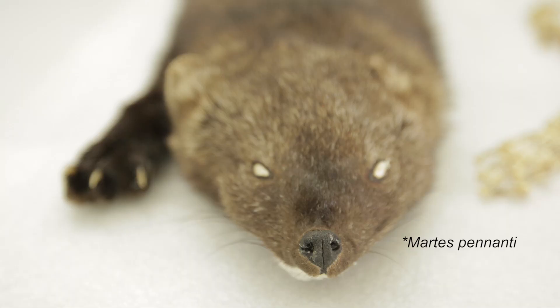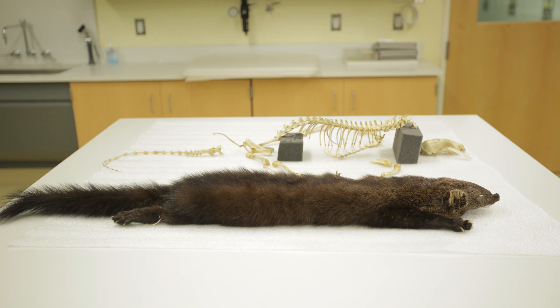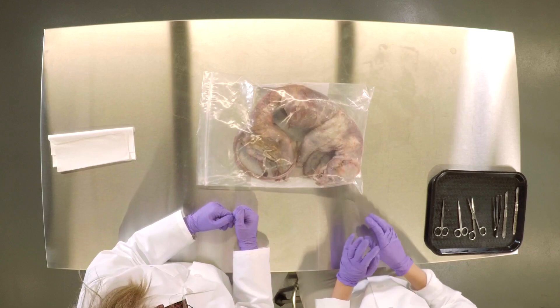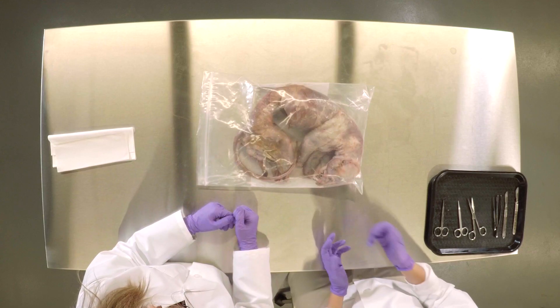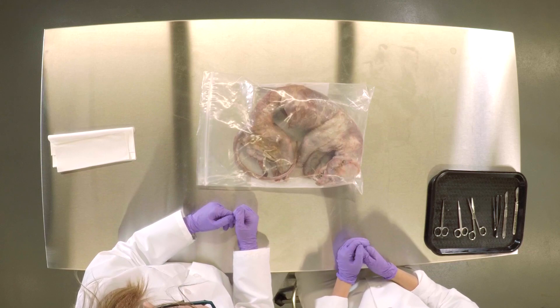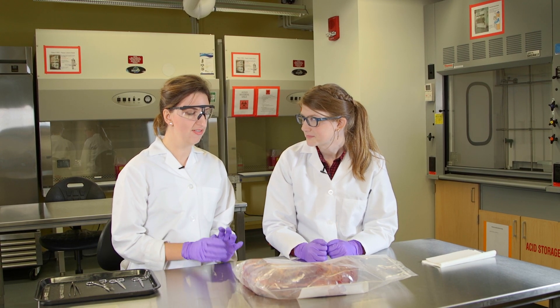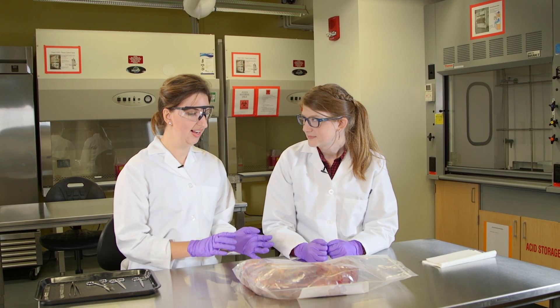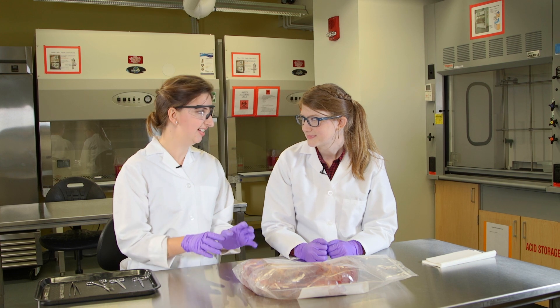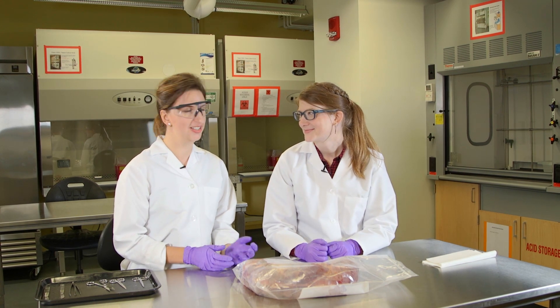The fisher cat is not actually a fish or a cat — it's kind of like a giant ferret otter. The skin has been taken off and gone to be used in collections, and all the organs have been taken out. Now we need to remove the head, the limbs, and get down to the vertebral column, which is what we're interested in.